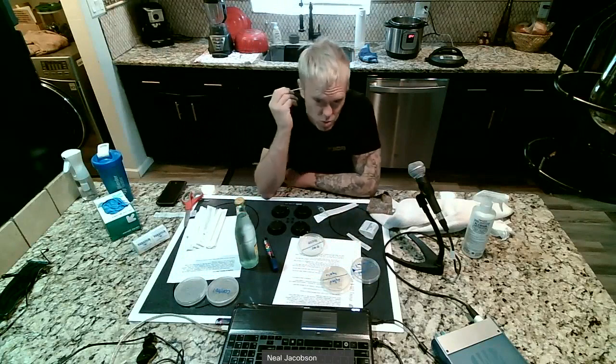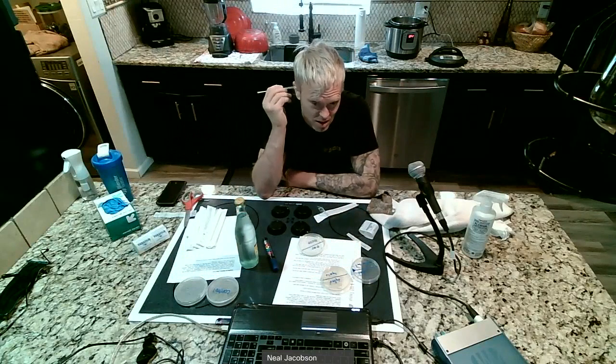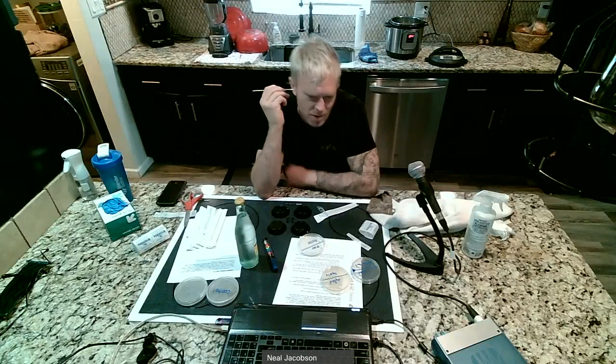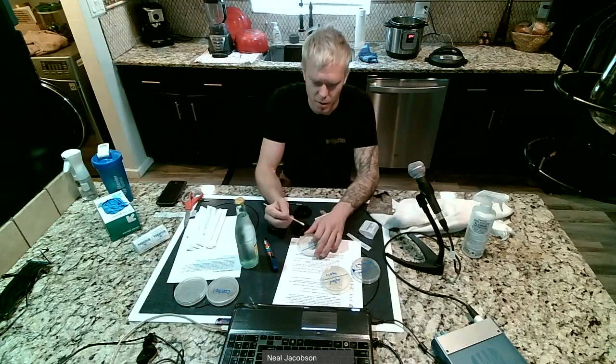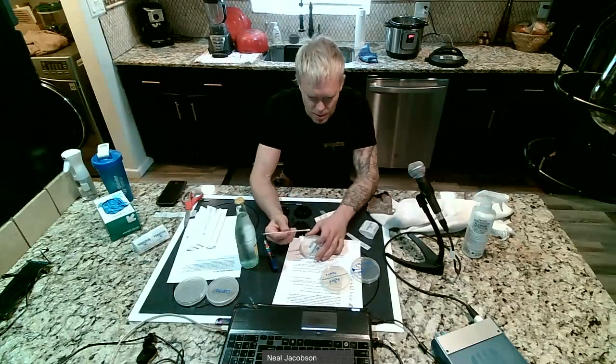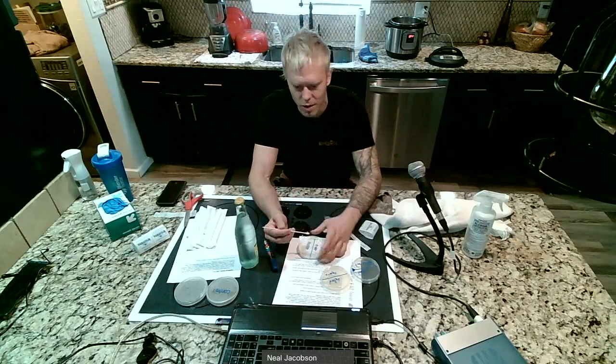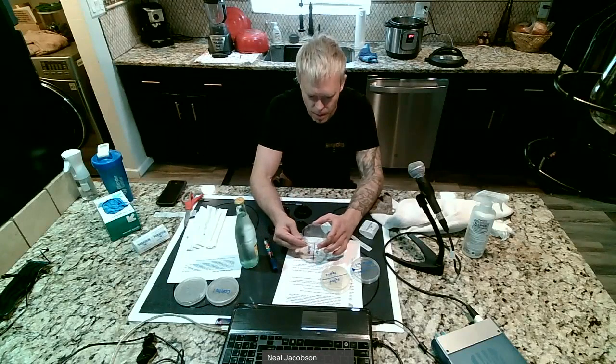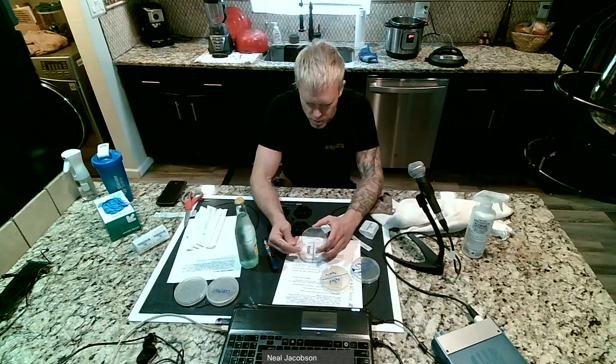I mean, if you guys want, you could test the inside of your ear versus the outside of your ear. That might be a fun one to check. So there's a lot of leeway here on how you do that. So I think I've got plenty. Now I'm just going to pick up my plate. I'm going to hold the lid above it so no dust gets on it, and then I'm going to rub it all over every last square inch of this. So I'm going to hold it, and then I'm just going to smear it.